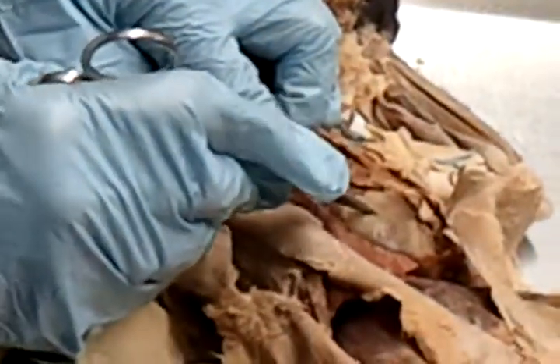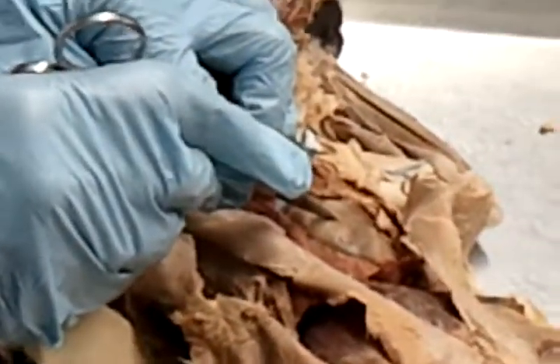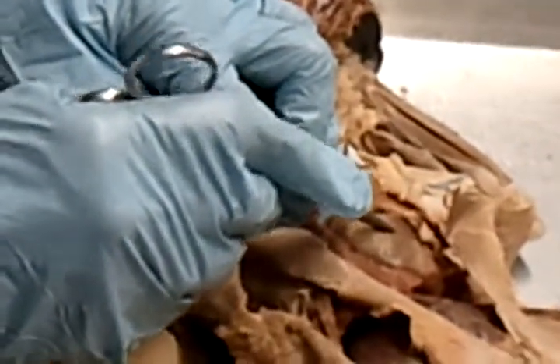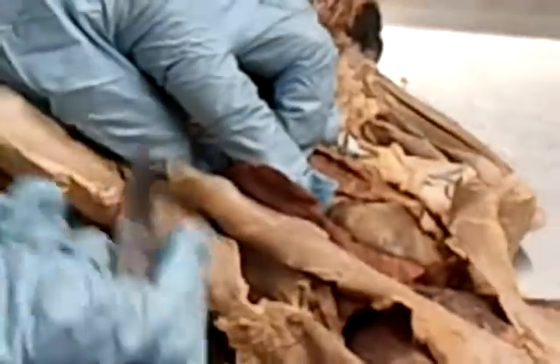So the heart wall itself would then just have the 3 layers. Visceral pericardium, whose name now changes to epicardium, the muscle myocardium, and the lining, endocardium. Very good. So I think everybody's up to speed on that. Well, then that was above the diaphragm, and we left the diaphragm intact.